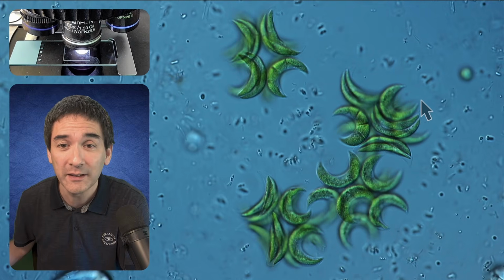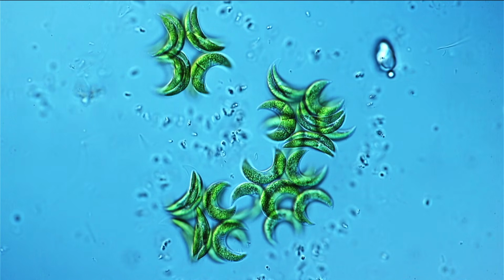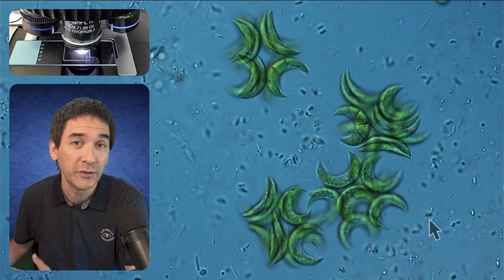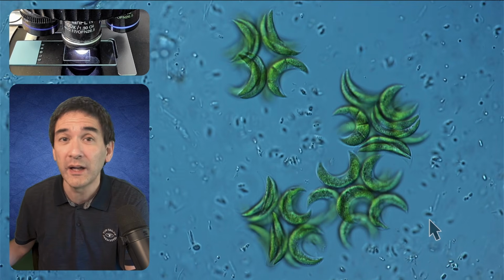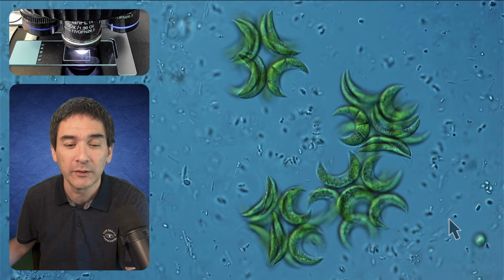As a matter of fact, this is a very common observation, even if there are no algae present. And I would like to show that to you. I've made a time-lapse video of around 20-25 minutes or so, and you can actually see how this aerotactic band is forming. I would like to show that to you.